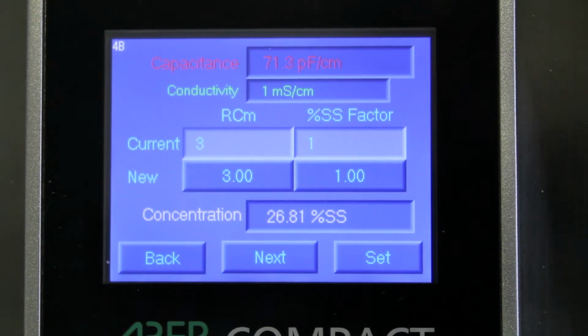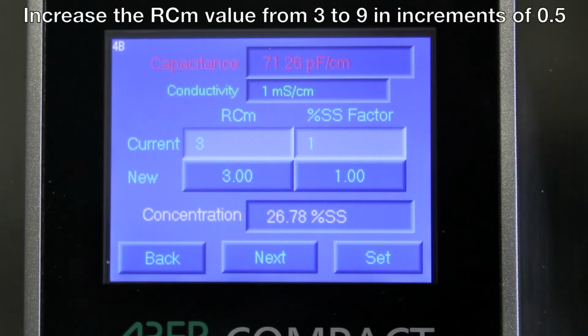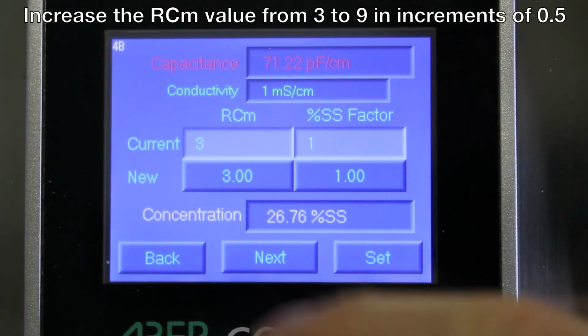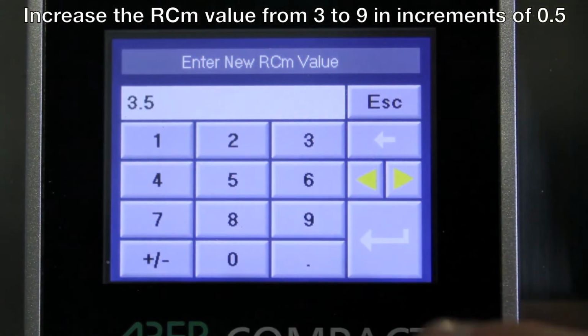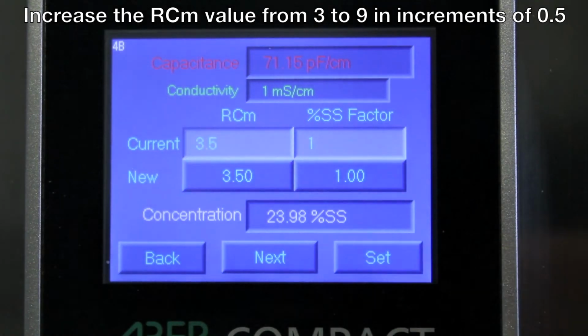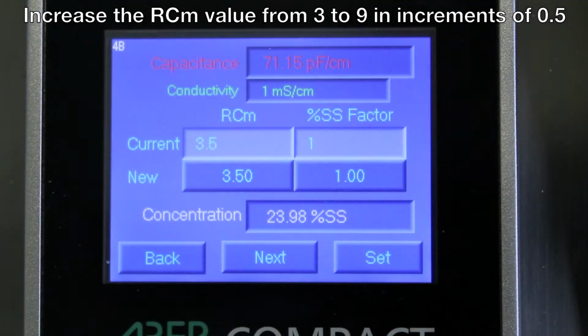In this case, while you're measuring your yeast sample with the RCM at 3, you can see you get about 26.8% spun solids value. Record that number in your spreadsheet or on your paper. You're then going to increment the RCM value by 0.5. So I put 3.5, then Enter, and then press Set to accept the value. You see the value jumps up to the current position and you'll see the concentration value changes.